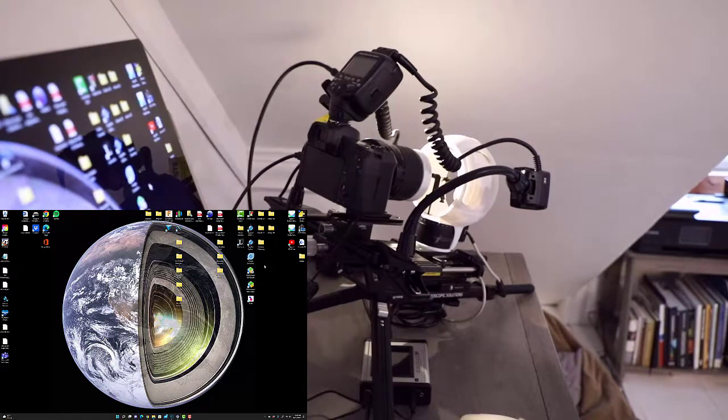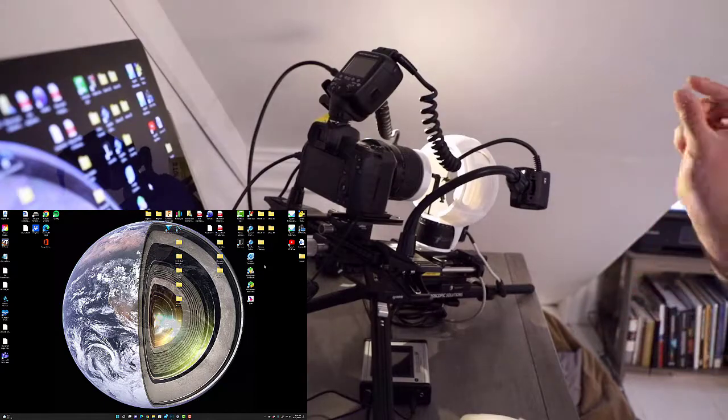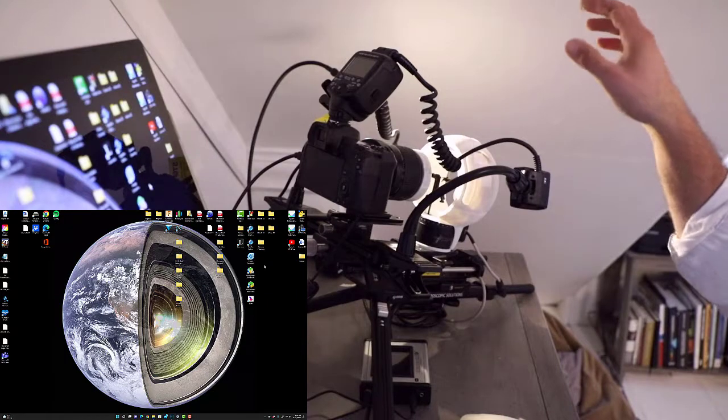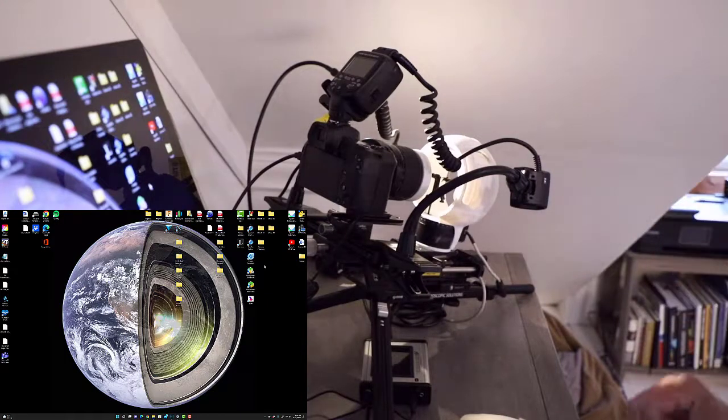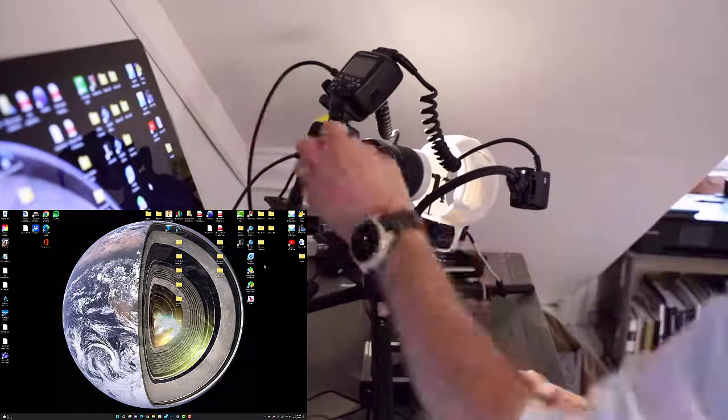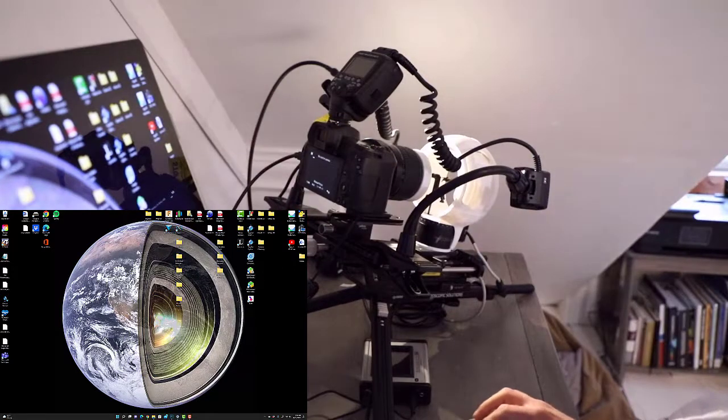So the first thing I'm going to do, we're using the exact same camera. We've rotated the specimen into a lateral view, and we've stepped the magnification down from 3x from the headshot that we had for the video, which is just how to image dark specimens, and we're now down to 1x. So I'm going to power the camera on now, and the EOS utility is going to open up directly on our computer.